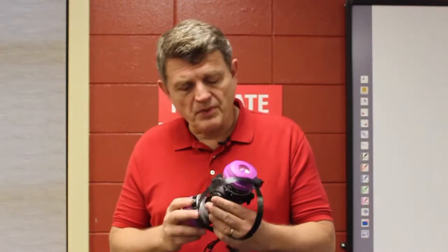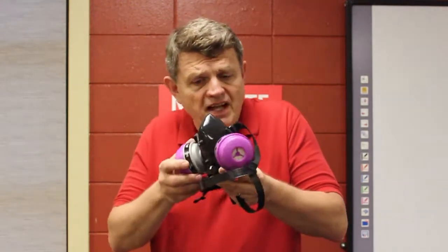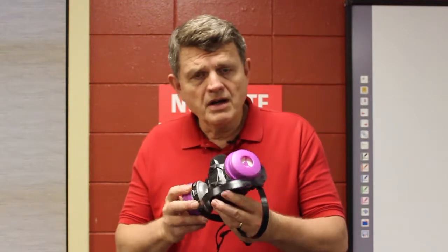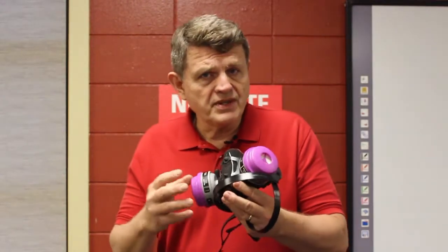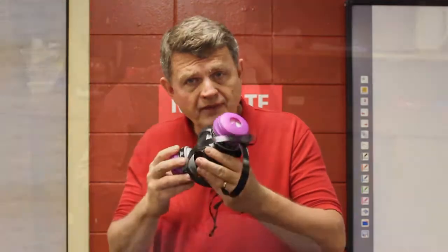If while you're using the respirator, you realize that it's not functioning properly or some hazard arises that it's not designed to handle, you need to get yourself to safety right away. Then you can take the respirator, figure out what's gone wrong, replace any parts that need to be replaced, and test it before using it again. Or if necessary, call for help for whatever hazard has come up in your work situation, or call for help for whatever medical problems you may be having.